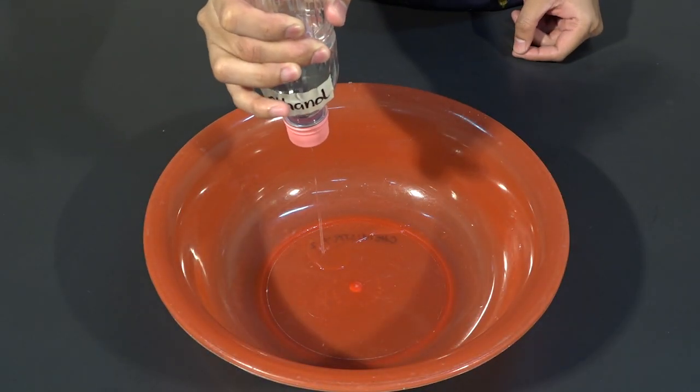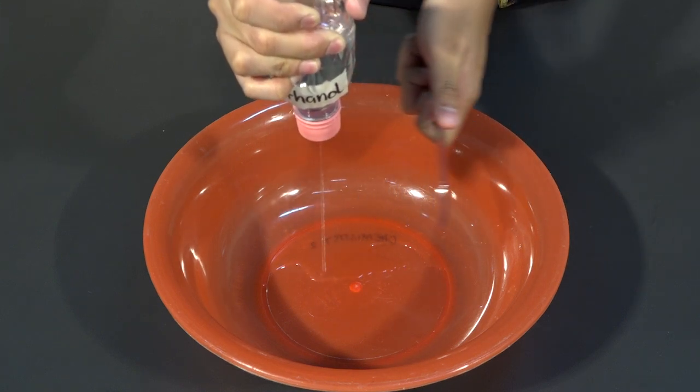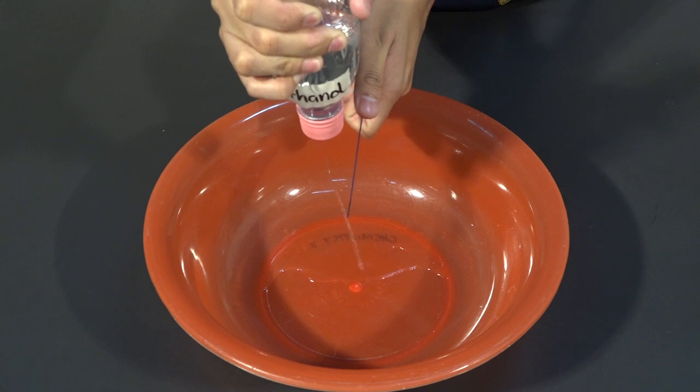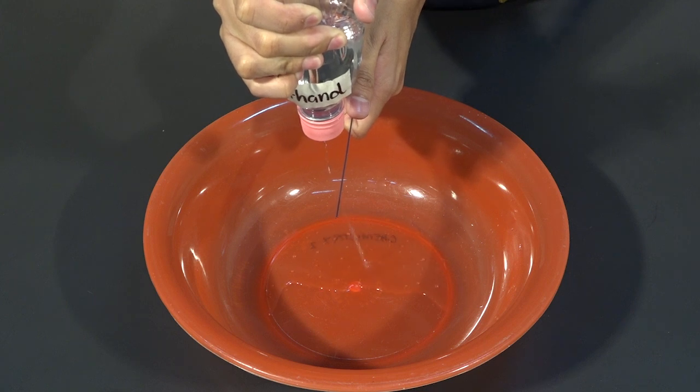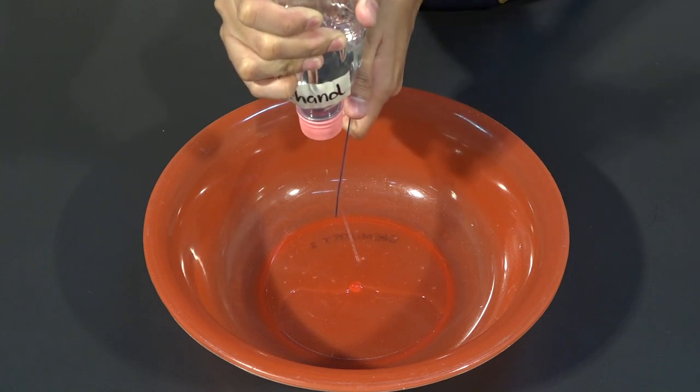Then, the PET bottle containing the 70% ethanol, turn it upside down, squeeze it to produce that fine, steady stream of ethanol. Because once your ruler is charged, you have to immediately bring it close to that fine stream of ethanol. Now, try to observe what happens to the fine stream of ethanol as you have brought the plastic ruler close to it. Based on that observation, what do you think is the molecular polarity of ethanol?